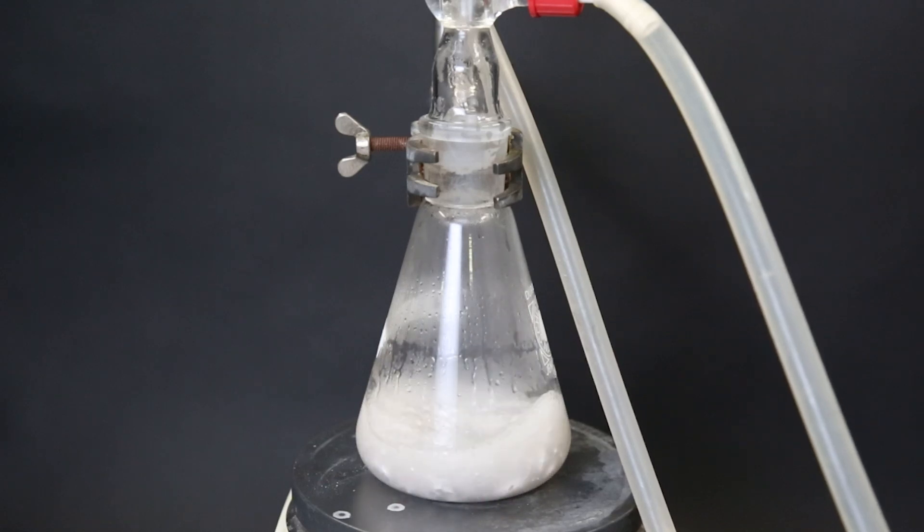But the sodium is less dense than the dioxane and magnesium is denser which will cause the sodium and magnesium to separate. So the sodium should float on top of the dioxane while the magnesium sinks to the bottom.